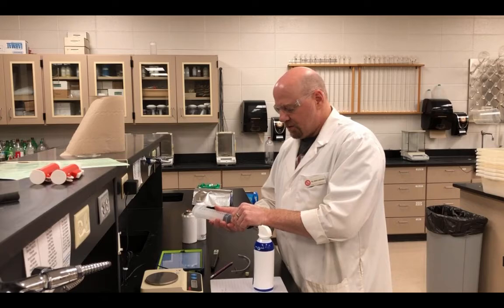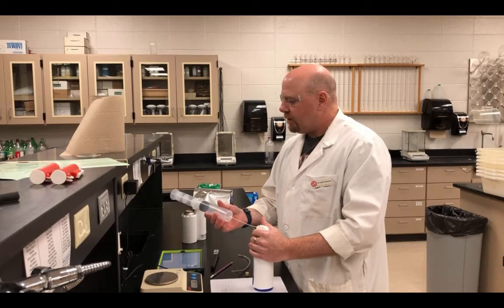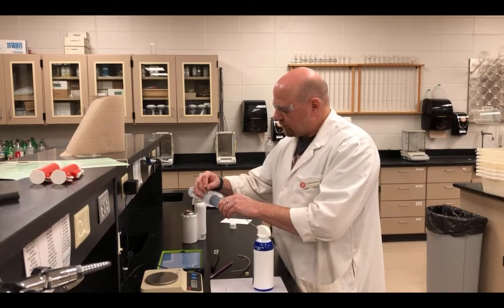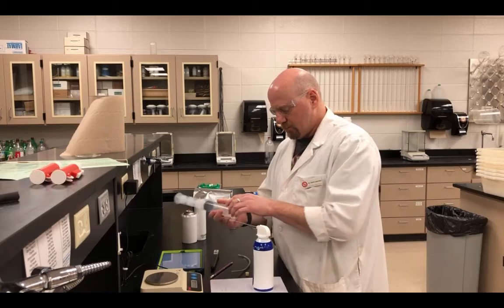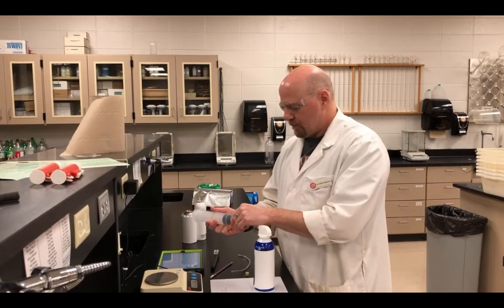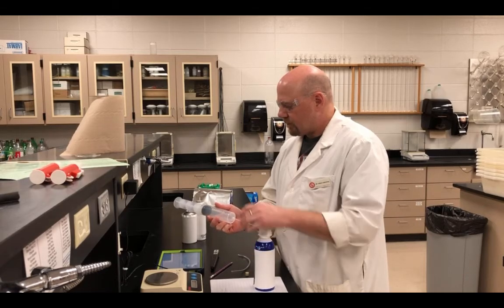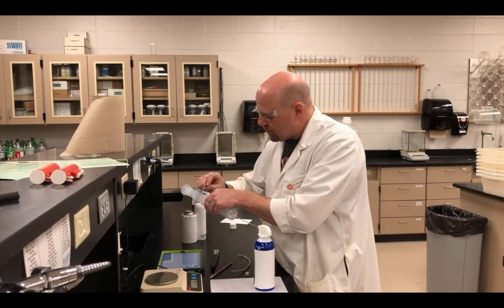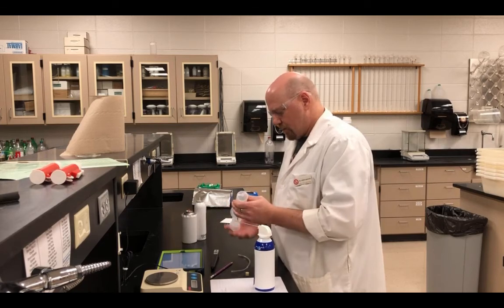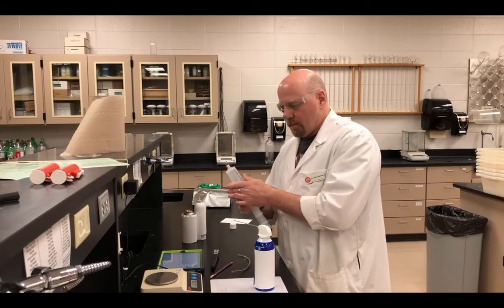Do the final collection, set the volume, or make more than what I need, set my nail, do it again. And take my measurement.